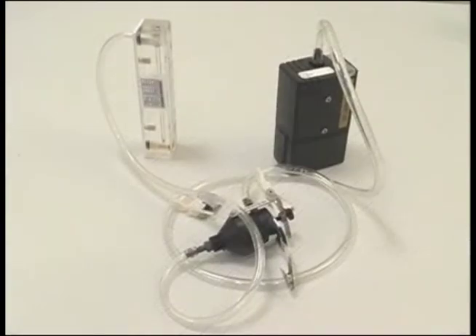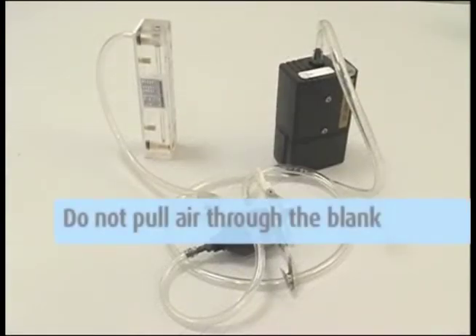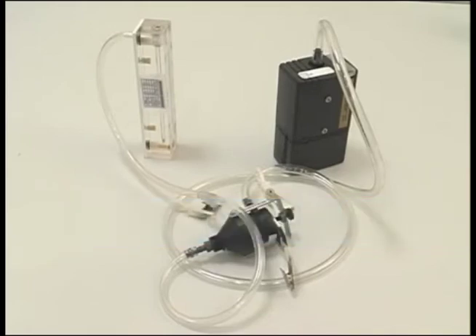Load and handle the blank IOM sampler in the same manner as the IOM used for sampling. Do not pull air through the blank. Send the blank in the shipment with the sample or samples.